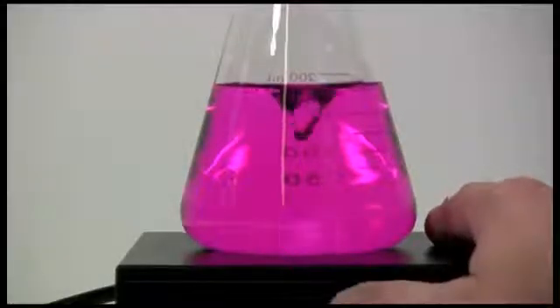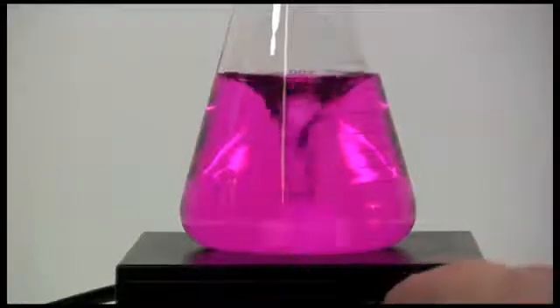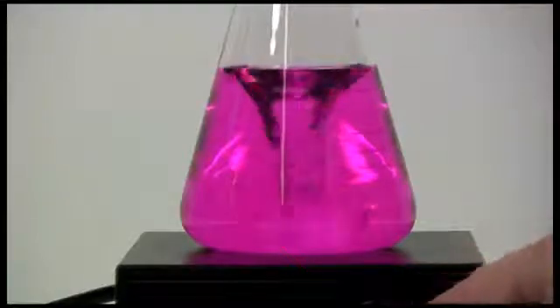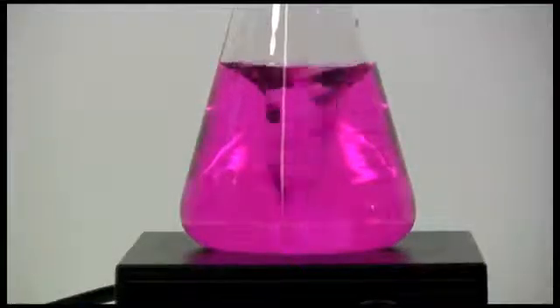Do that by adjusting this on the bottom. Notice I can get a really nice cone going here. If I really want to crank it, I can mix things incredibly violently in that little vial.